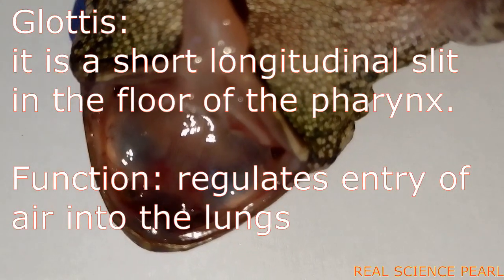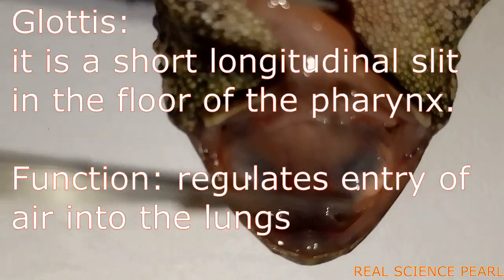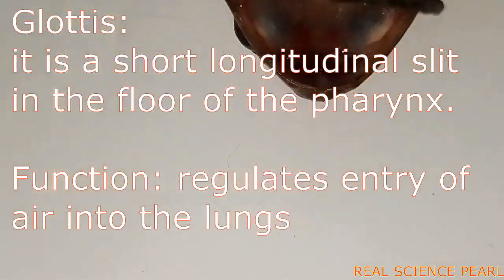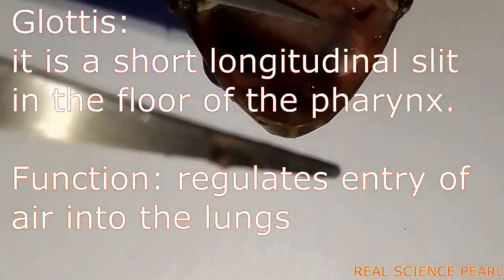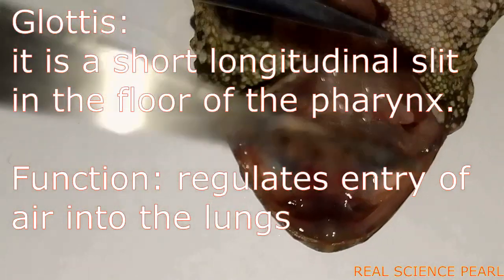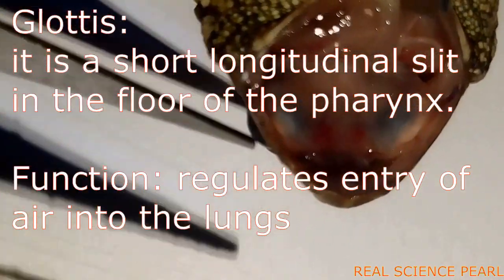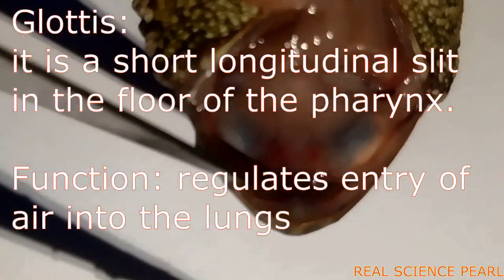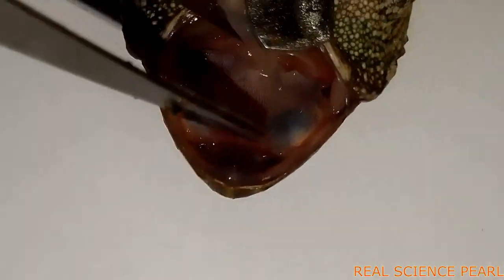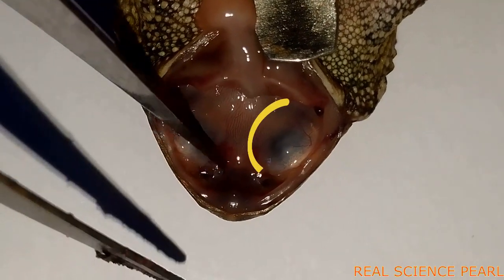The glottis is a short longitudinal slit in the floor of the pharynx, through which air passes into the lungs.